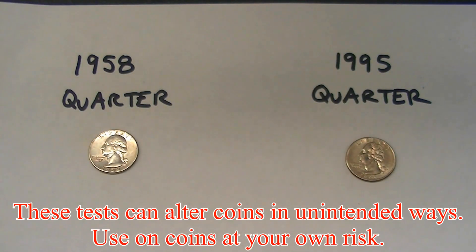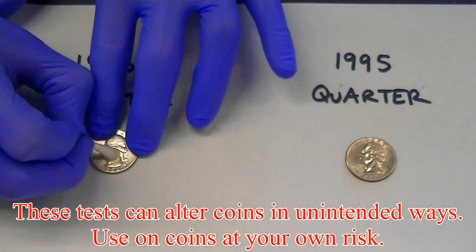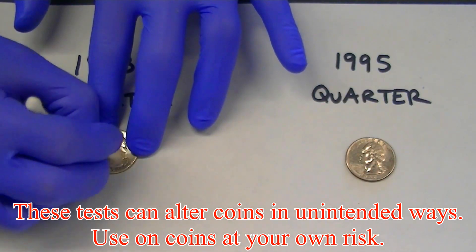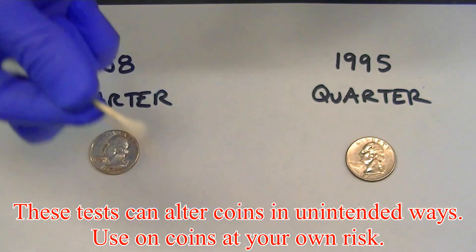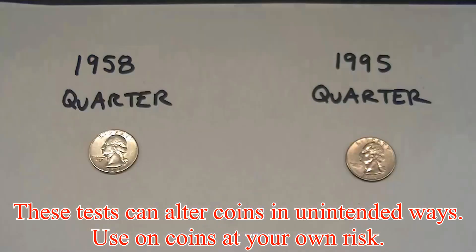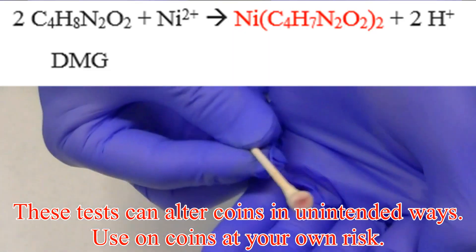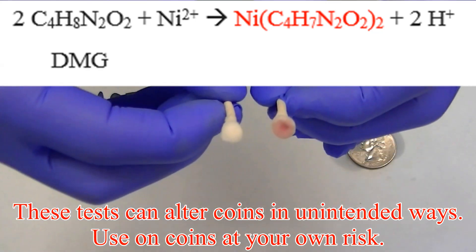Let's use some chemical tests to see if there are any differences between these two quarters. First we'll use the DMG test. When I rub one quarter with a mixture of ammonia and DMG, I don't see a color change — so this quarter probably does not contain any nickel. When we apply the same test to this 1995 quarter, we do indeed see a color change, so this quarter does contain some nickel.